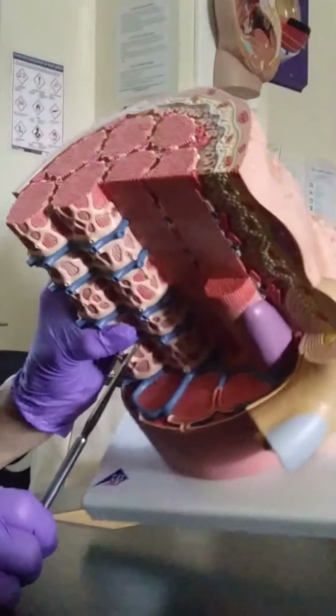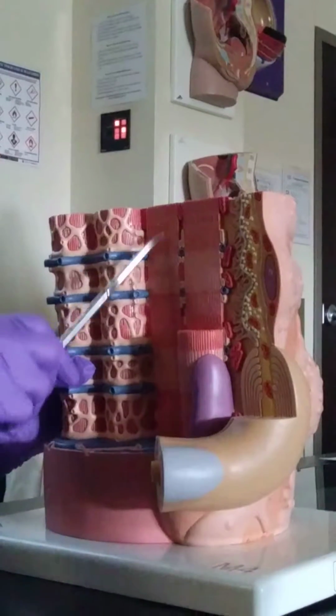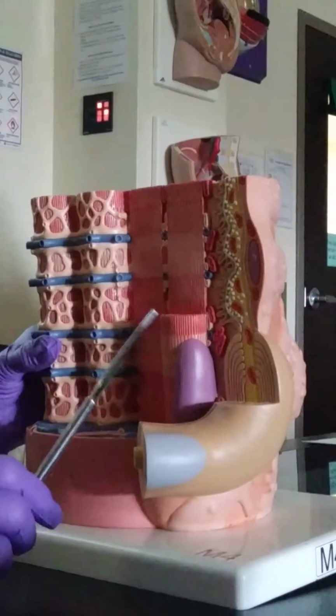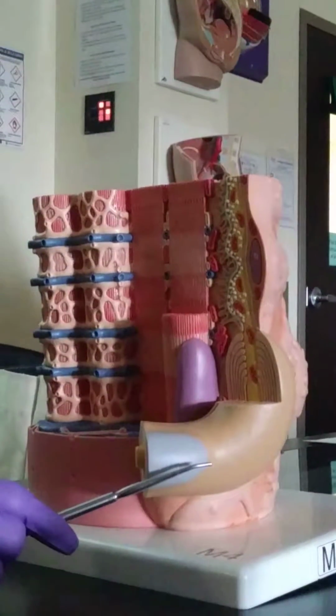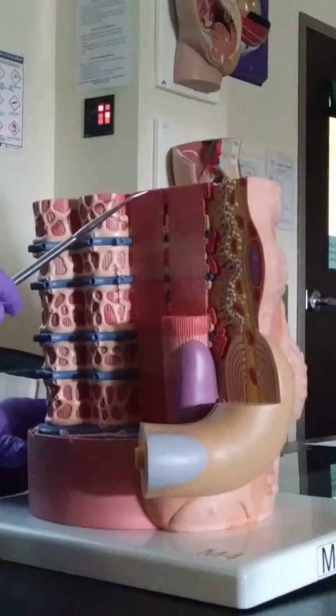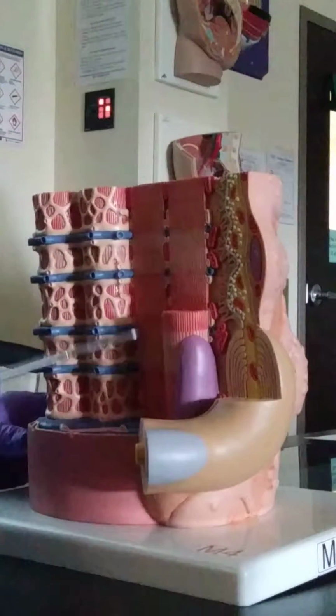We can see those myofilaments a little bit better if we come over here on the side. So can you see them right here, the thick and thin? Remember in our lecture we learned about the light and dark bands? So that's what we see right here. Can you see the dark band and then the light, the dark and then the light?